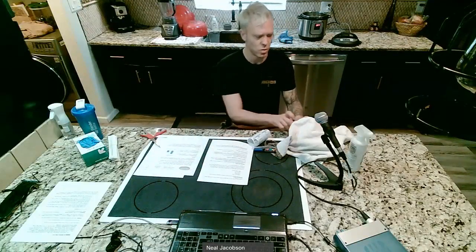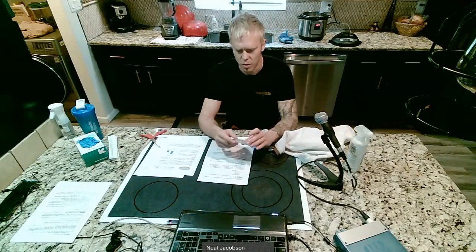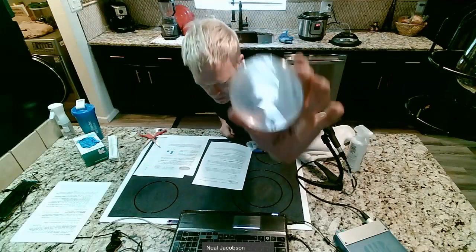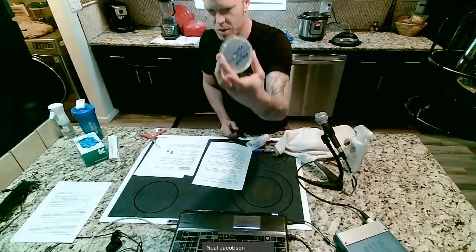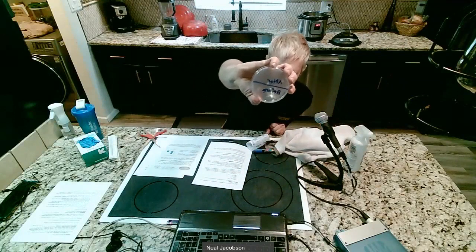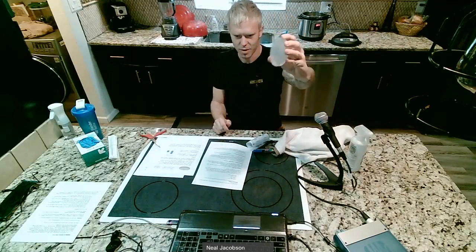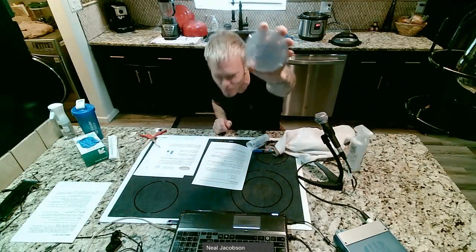So we're going to test it. What we want to do first is take one of our petri dishes, and I've got them covered up so that we don't get any dust on them. On the bottom of the petri dish, I wrote before and after. I wrote it backwards, kind of like you're looking in the mirror. That way, when you look from the top, you can see after on the top and before on the bottom. Sorry, my image is mirrored, so it's hard for me to do this.